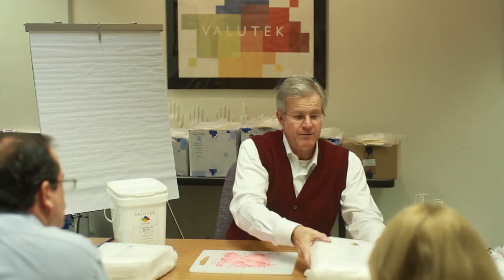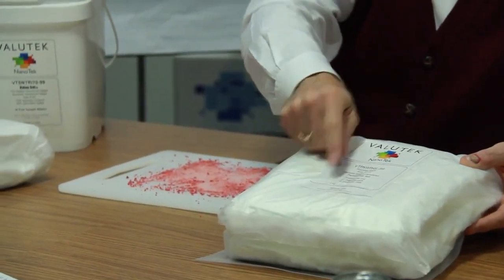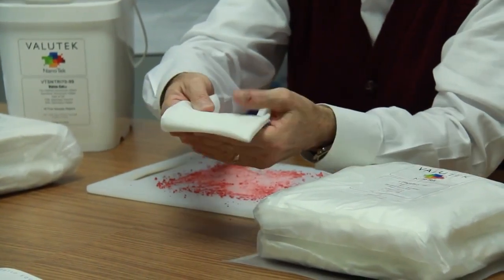So this is just an illustration using gross contamination because we can see it. If we did this test with submicron contamination, we couldn't see the particles, so we couldn't illustrate it. But large particles behave the same way that small particles do. First, I want to take one of our best-selling wipers. This is our polyester, standard weight, pressure heat sealed wiper. So it's a very, very clean wiper.